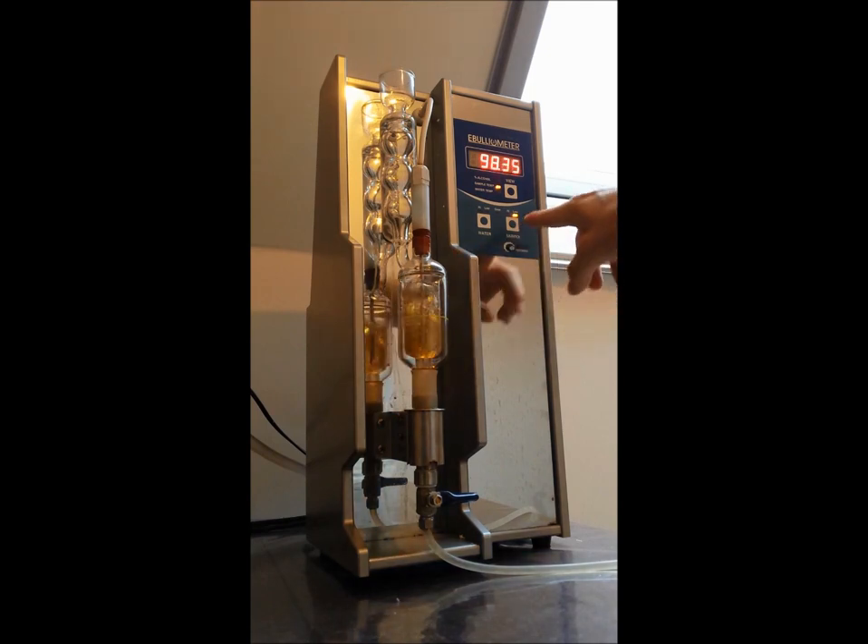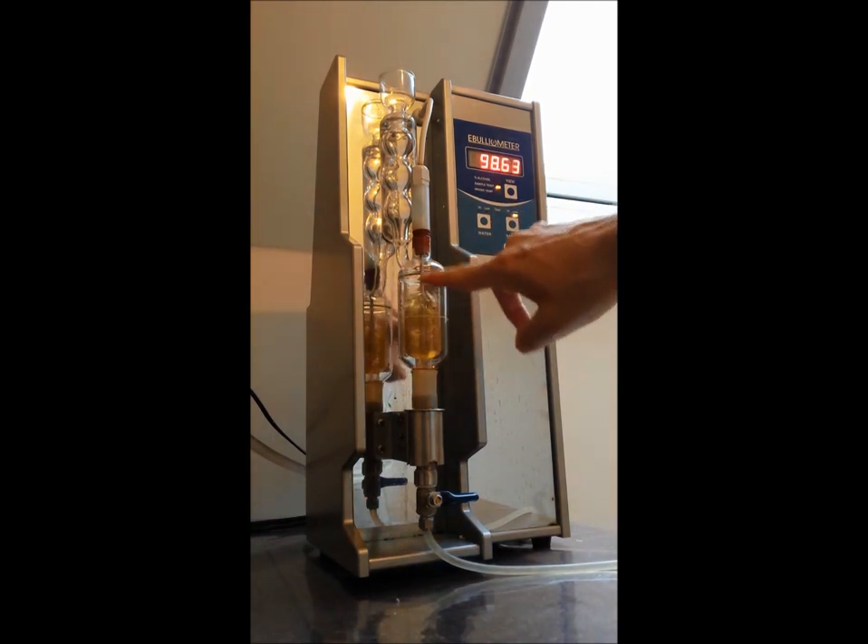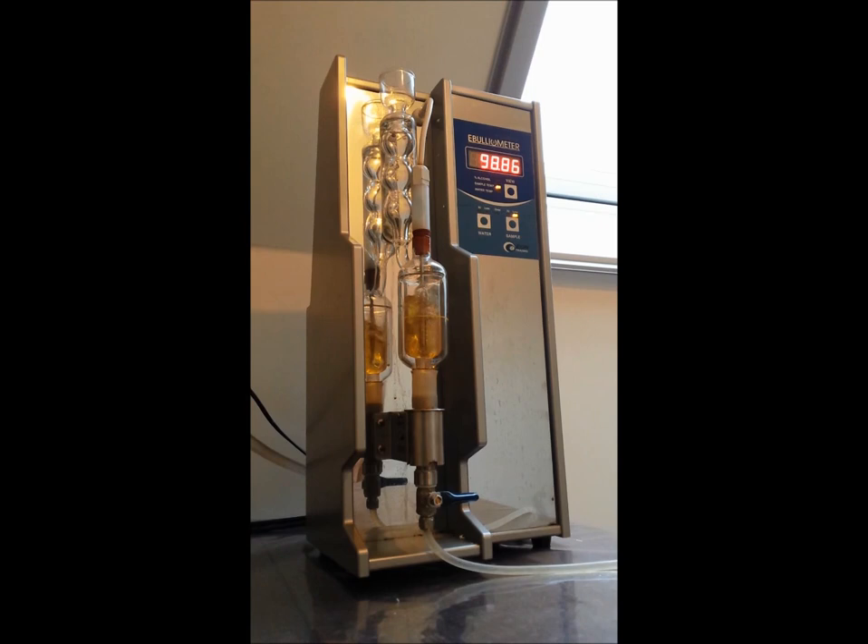As you can see at the last stage of the boiling process, it's boiling more heftily inside and still no foam. So this is very good for stability.